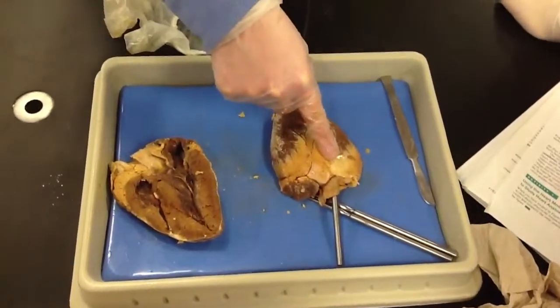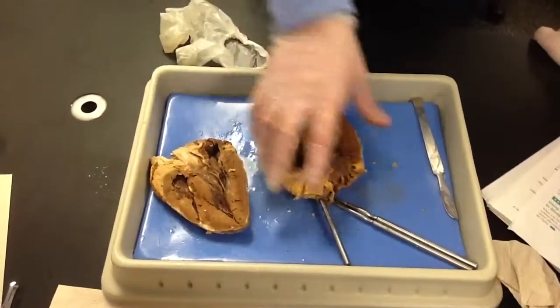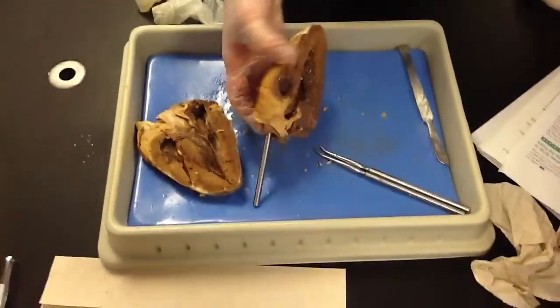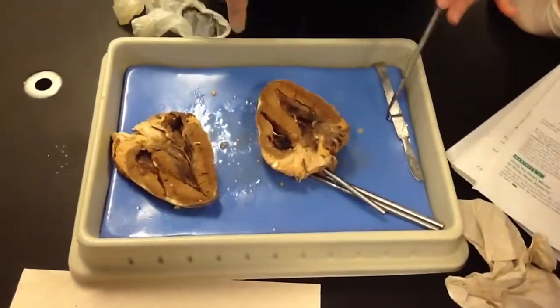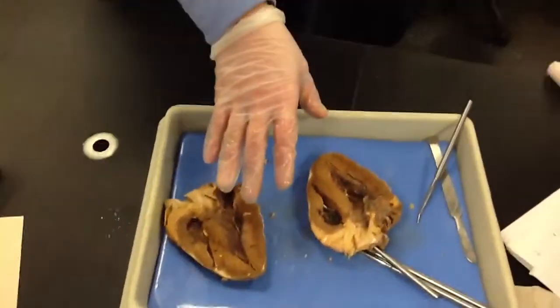This is easier to identify, huh? Yeah, I always say if you follow this through and find your blood vessels, you can see which side's the front and which side's the back. Alright, do you want to walk me through the actual blood flow? Do you guys feel comfortable with that yet? No, can you explain it?